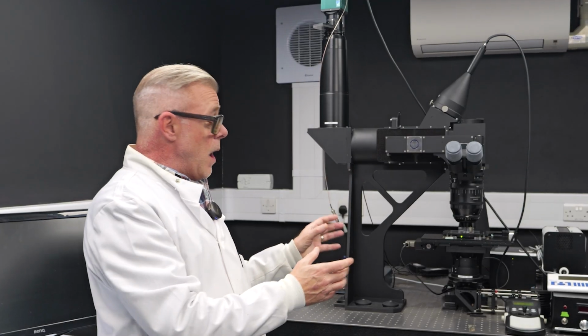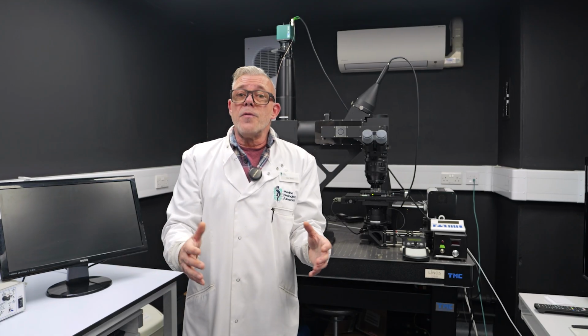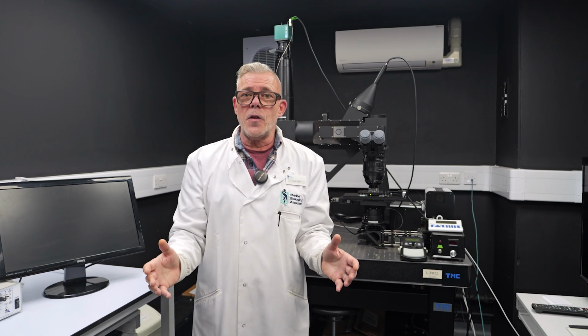The Mesolens microscope works in a very different way. It has a very wide field of view, so when used in combination with a high resolution camera, we can gain very detailed information on multiple organisms across a wide field, and we can zoom into that image once we've captured it with no loss of quality or resolution. So we're able to get a far more detailed view over a much wider area.